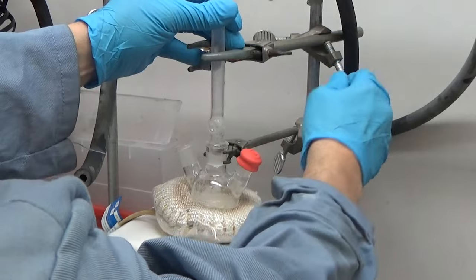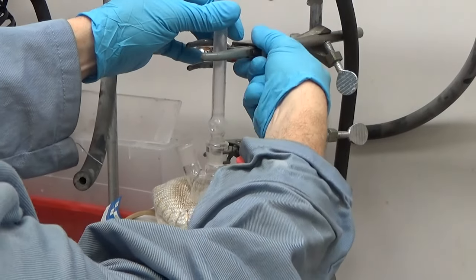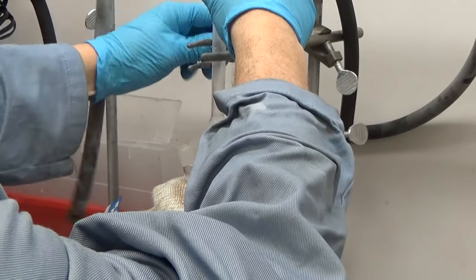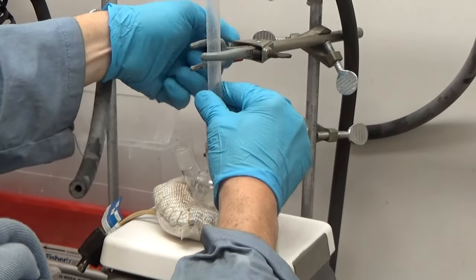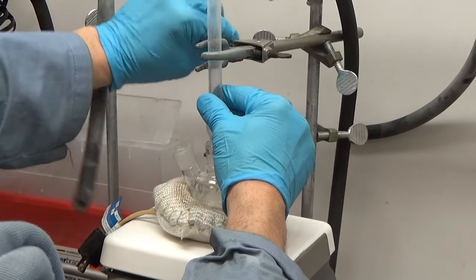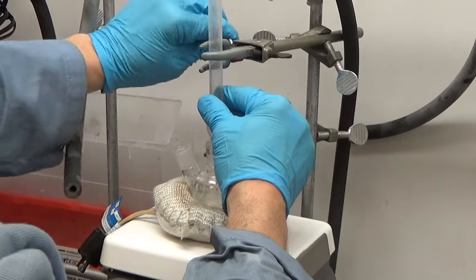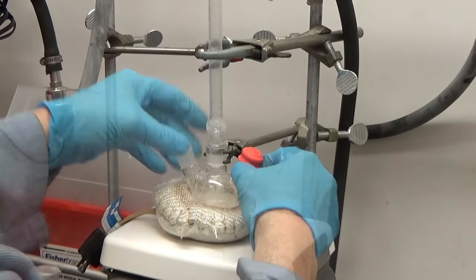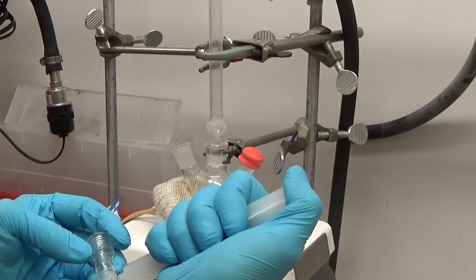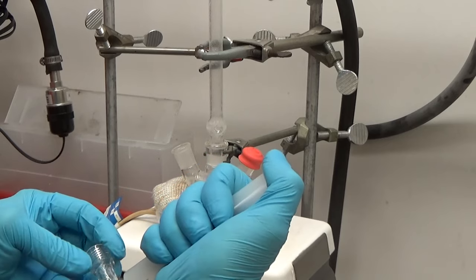Now I like to use very heavy duty clamps because if you recall, we're going to inject this at 310 degrees. That's pretty scary. If this gets accidentally knocked over and breaks open, God forbid, probably going to have a fire on our hands. So I like to strap this in as hard as I can.